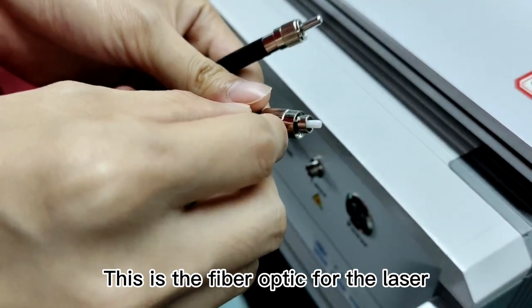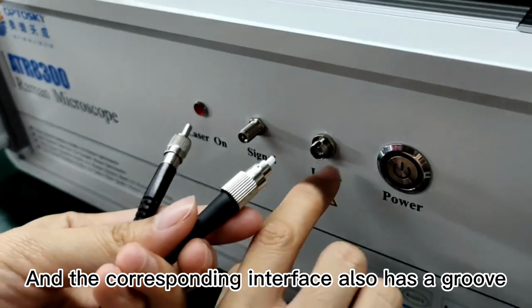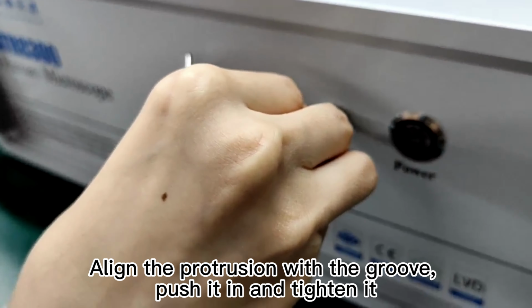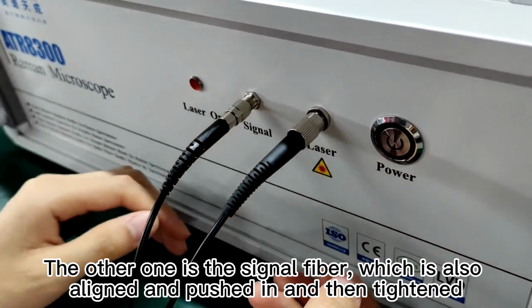Next, we introduce the precautions for installing fiber optic cables. This is the fiber optic for the laser. The connector of the laser optical cable has a protrusion, and the corresponding interface also has a groove. Align the protrusion with the groove, push it in, and tighten it. The other one is the signal fiber, which is also aligned and pushed in and then tightened.